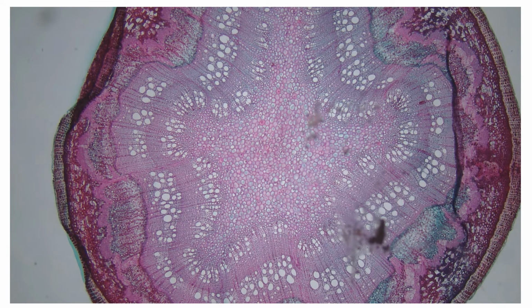Boom, we got it. I like the way this one looks because that initial image in the center kind of reminds me of a cool looking sea star. That's pretty neat. I guess it's kind of a little teaser, if you will, an Easter egg, of what we'll talk about in the second half of the semester. But as it is, on first glance, it looks similar, but there are pretty key differences to the pine. And hopefully you're starting to recognize some of those as you compare them.